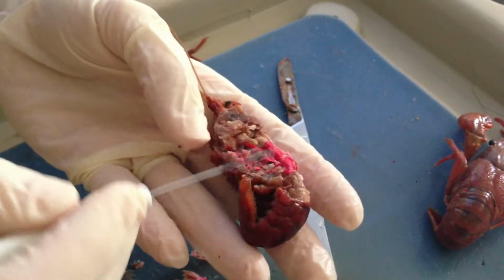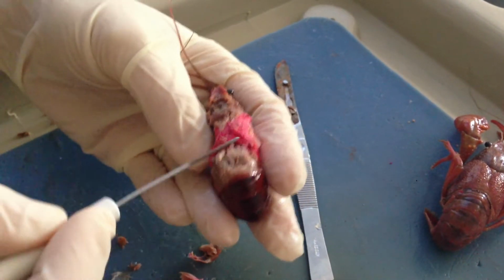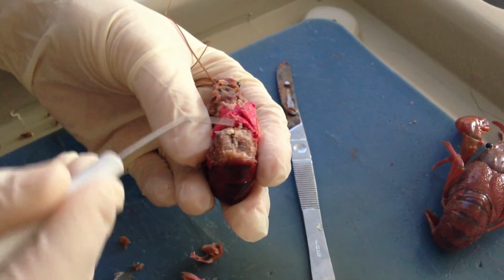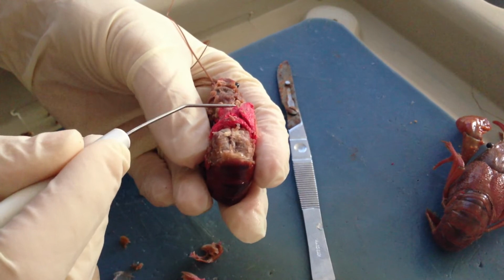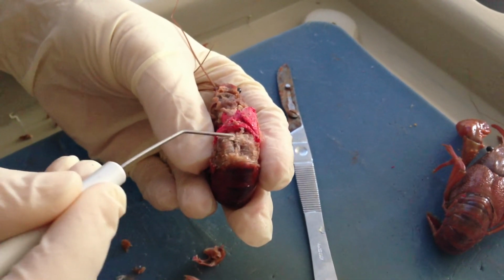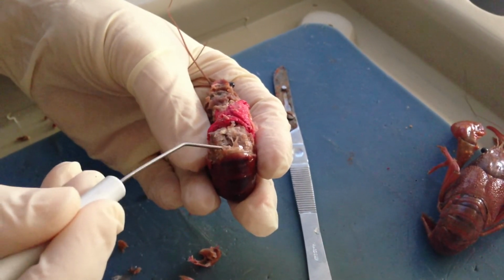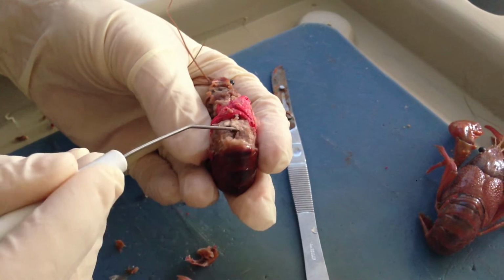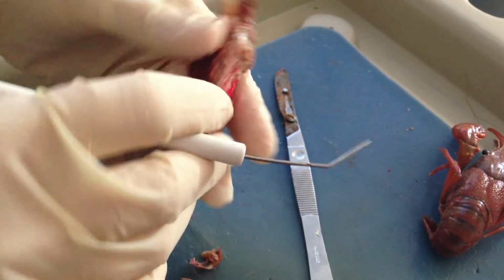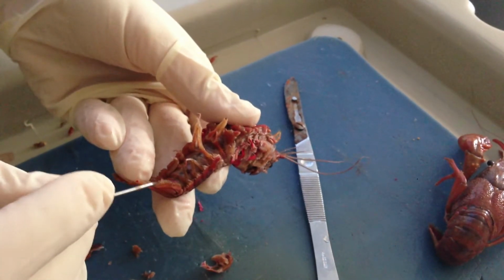And this particular organism is a male, and so I removed some of the abdomen here, and you can see these two white structures just posterior to the heart, which is this structure, and these are the organism's testes. This tube right here, which is kind of broken apart, is actually the organism's intestines that are going to run down and exit this area right down here.